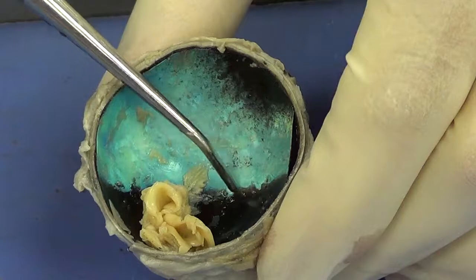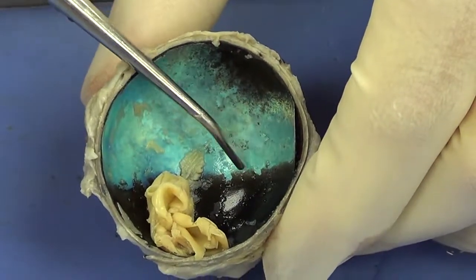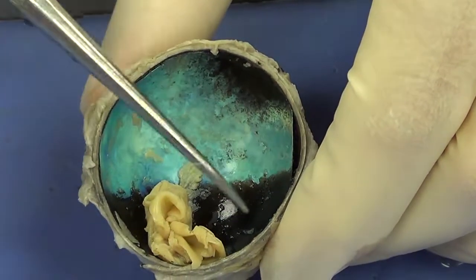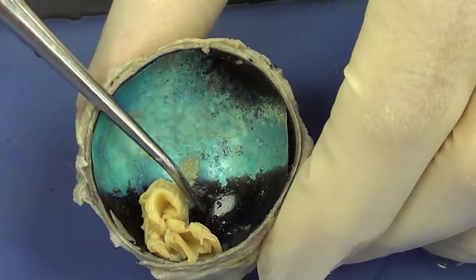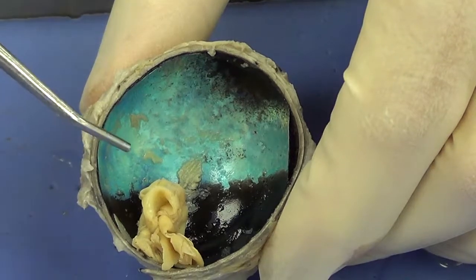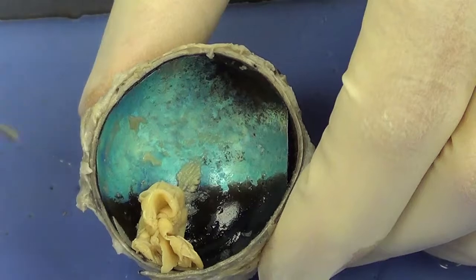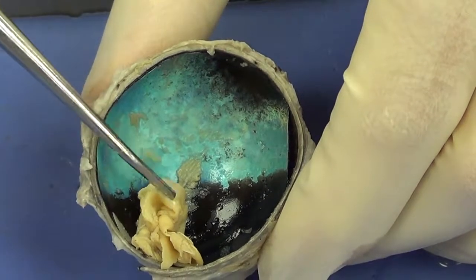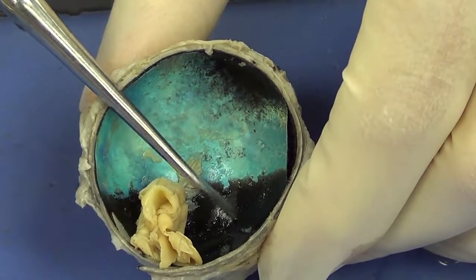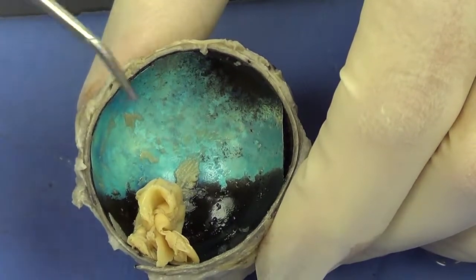Now if I remove that, and actually the tapetum is going to be continuous with this other black layer you see here, that's called the choroid. The choroid is very vascular, contains a blood supply that serves the eye. The black color of this choroid also serves to absorb light. So when light comes into the eye, a lot of it is going to strike the retina and get absorbed, but extra light that passes between the nerves of the retina is actually going to strike this choroid and get absorbed, so it's not reflected around the inside of the eye and we don't have blurry vision.